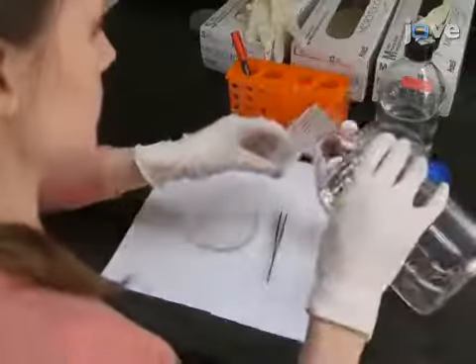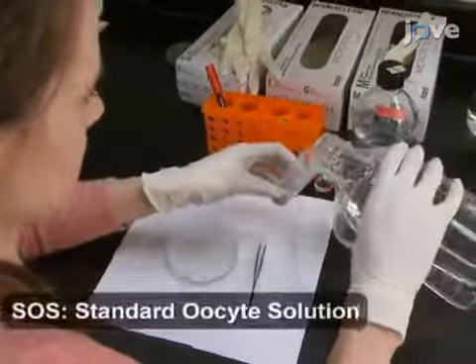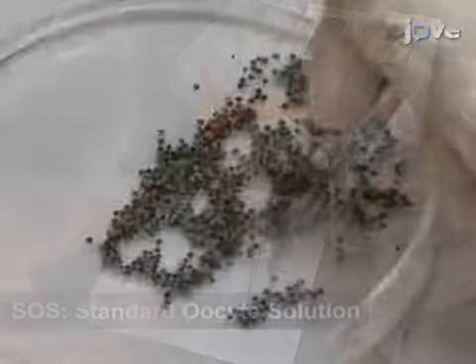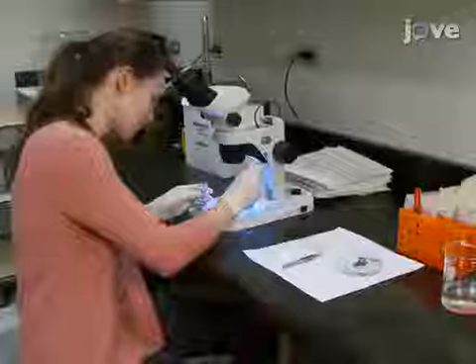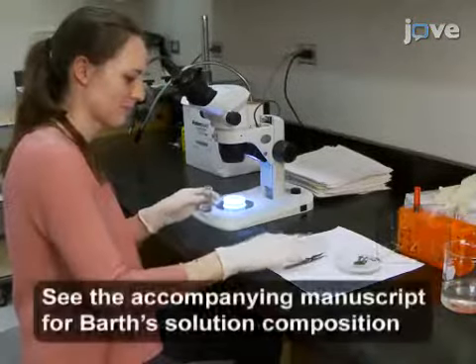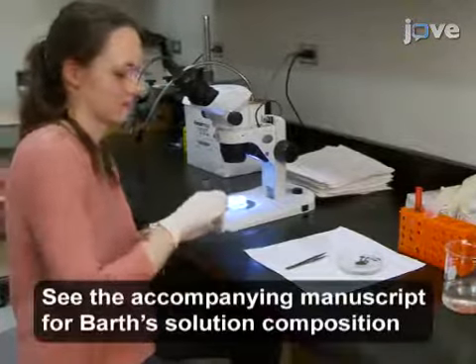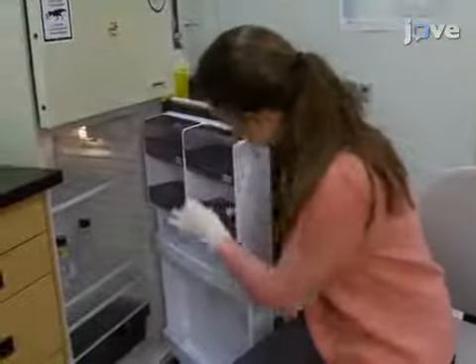After surgical removal of the Xenopus oocytes, wash the oocytes 3 times with SOS solution. Select large and healthy oocytes individually and incubate them at 18 degrees Celsius for at least 4 hours in Barth's solution supplemented with antibiotics and 5% horse serum before injection.